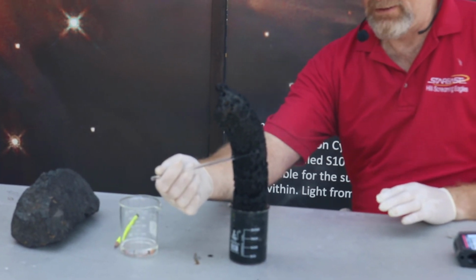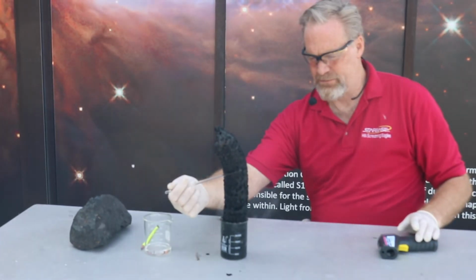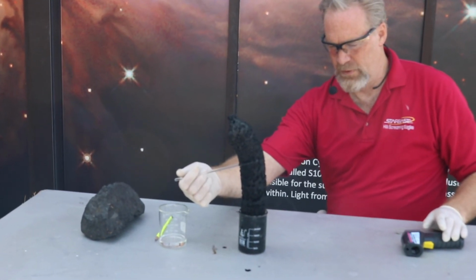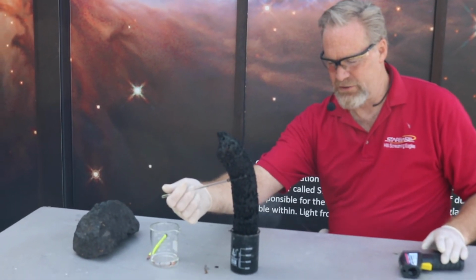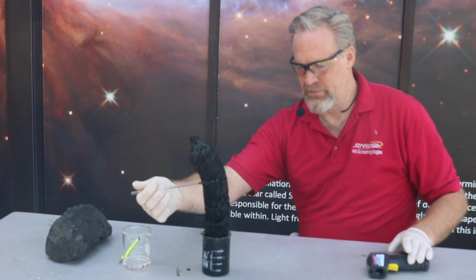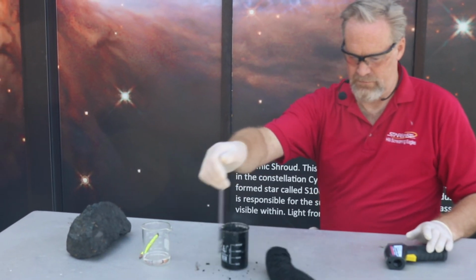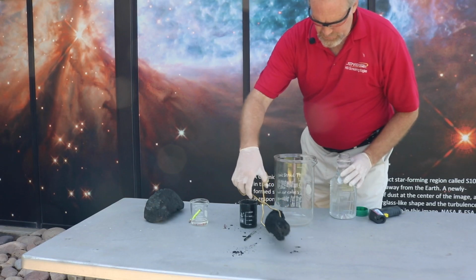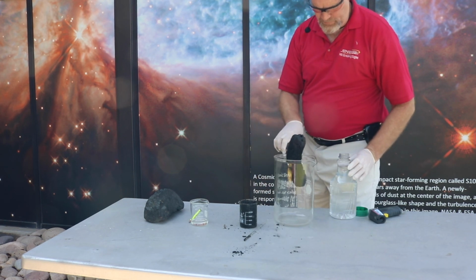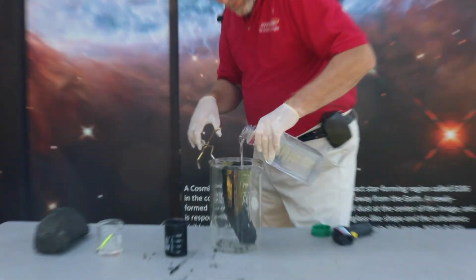Okay, is this solid like charcoal? It's not. Let me rinse it off, and I'll show you how less dense it is. It'll fall down right there. I'll pick this up with the tongs. It's still pretty warm. Put it into this jar. A little bit of water on there. Cool it down.